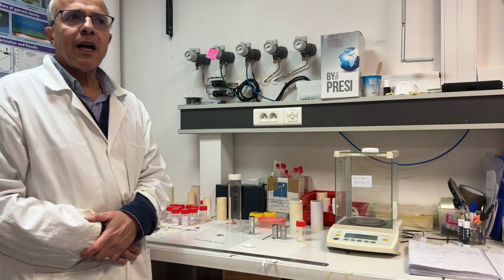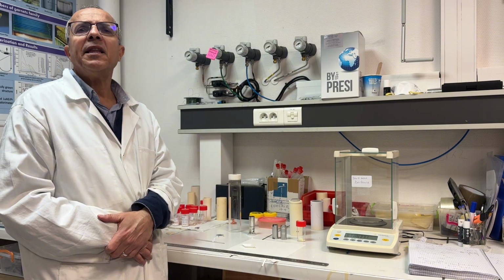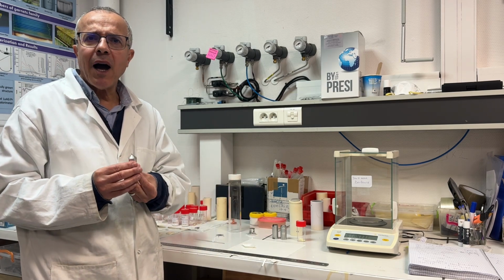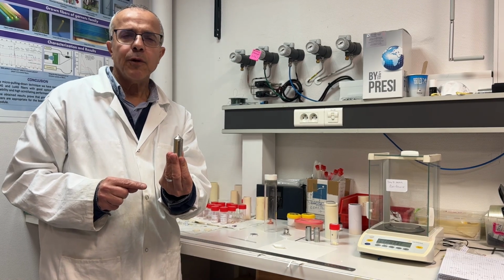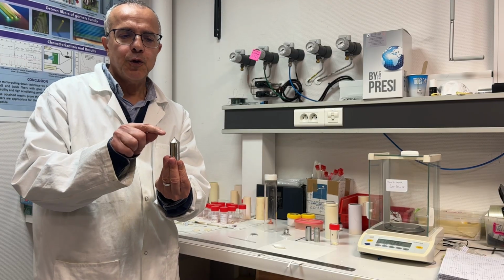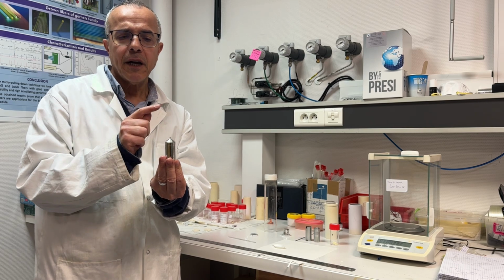With micro pulling down, we can prepare fibers or plates or other shaped crystals. It depends on the crucible design. I show you an example of a crucible which allows us to prepare a fiber shape. That is a micro pulling down crucible used to grow fiber of diameter 2 mm. You see here the capillary die shape which allows us to obtain the fiber shape.